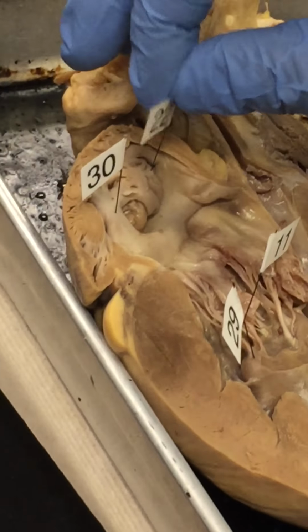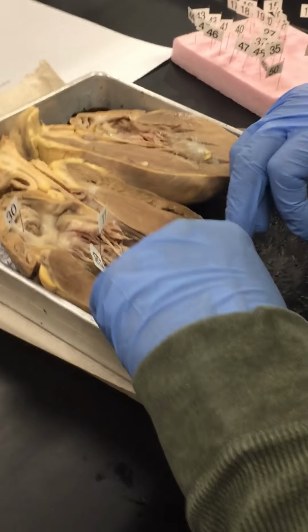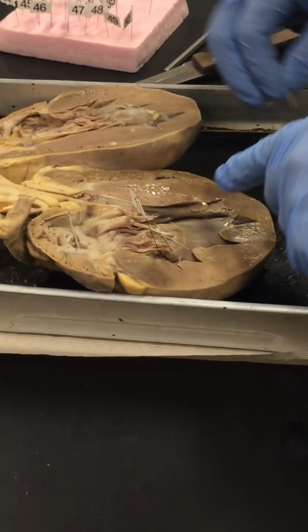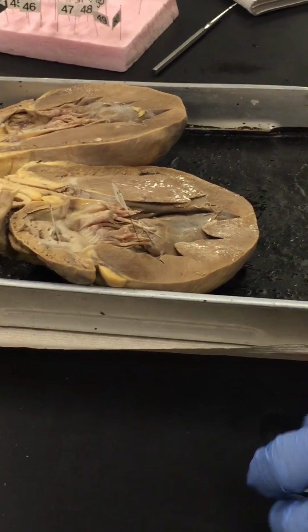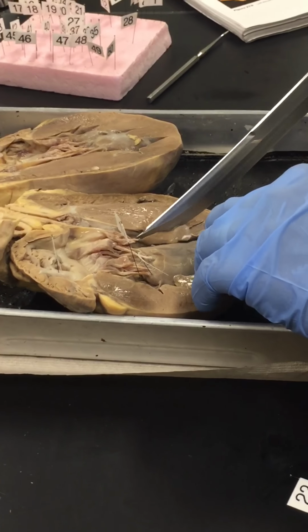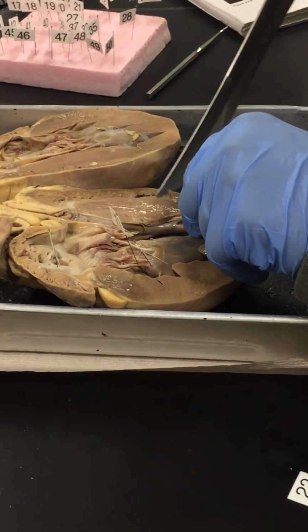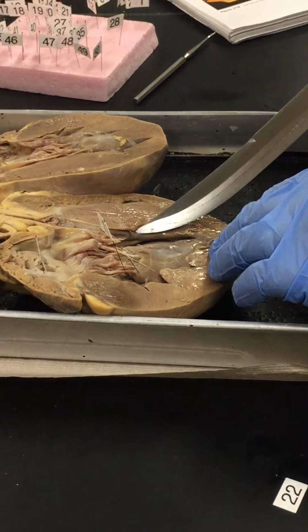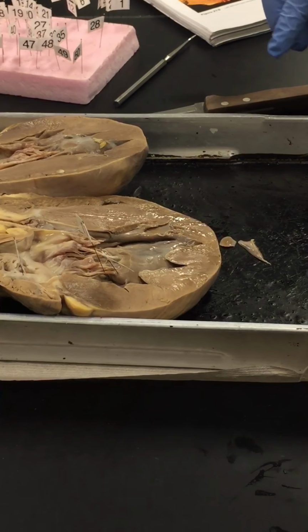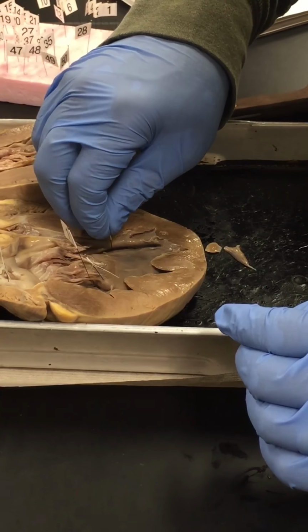The best trabeculae carneae are going to be down here actually. I want to make a better spot for them. They're pretty obvious when you see them. I'm going to put them right down here. There's a better place for it here. I'm going to cut a little bit of the wall off so you can see that trabeculae carneae better. Okay, so I'll put 22. There's some in the atrium too, but it's okay.